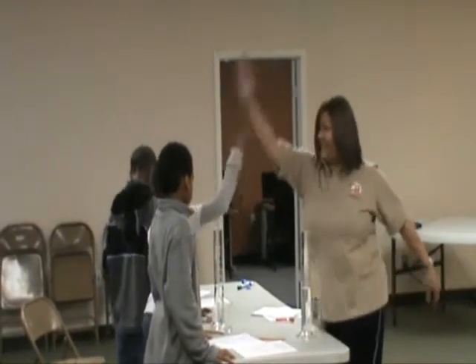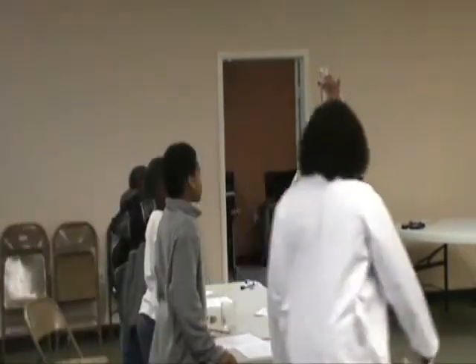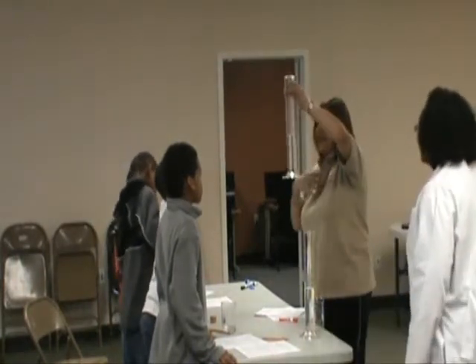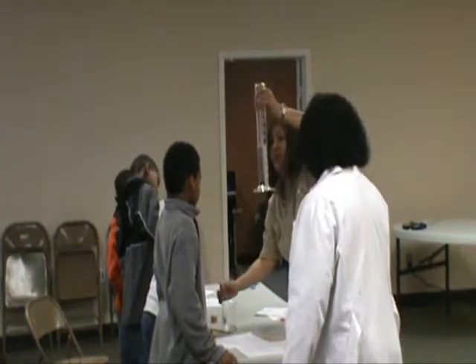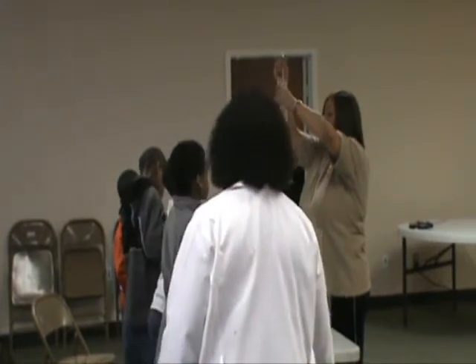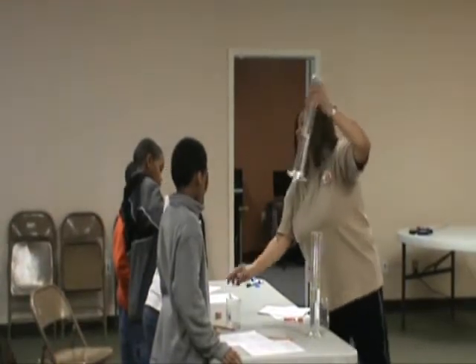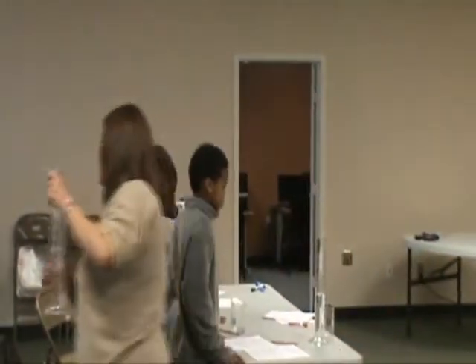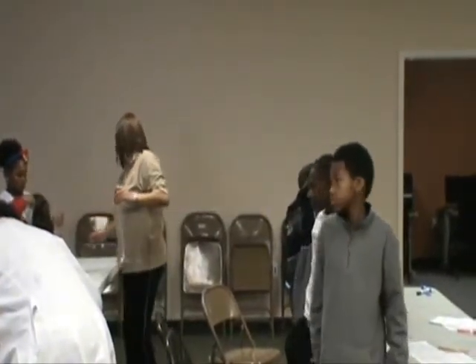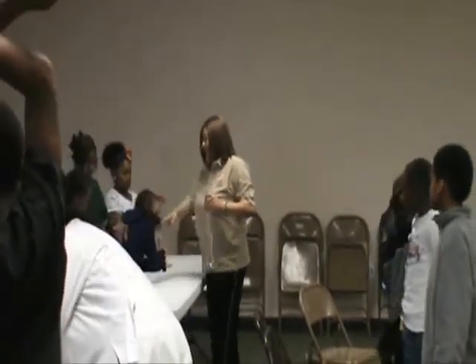I'm going to mess yours up, because he's got to practice with the pipette. Look at this. I don't have to walk around and show y'all mine. Look at the students. He actually needs maybe one little bitty drop, but that was pretty good. Now, I don't want you to pour to the top because I want you to practice this. I'm getting ready to come around. Now, remove all air bubbles from your cylinders. Remove the air bubbles.